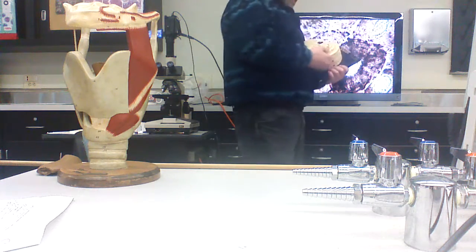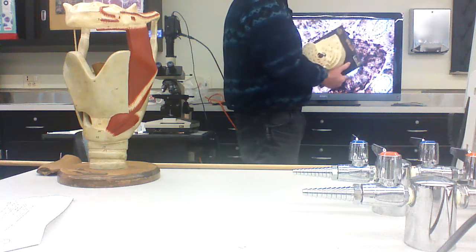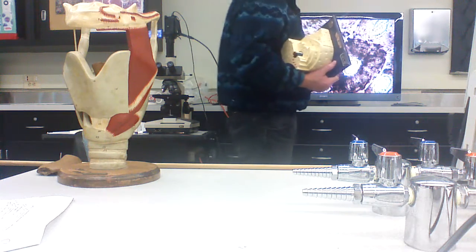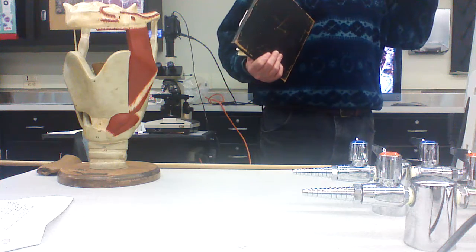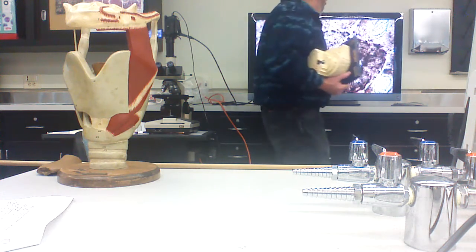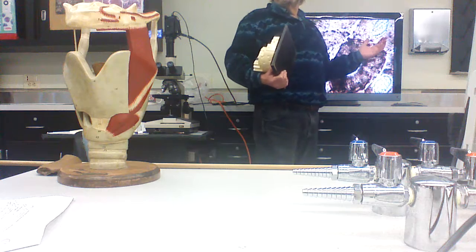And there are lateral canals which attach one Haversian canal to another. So if you have a cross section of compact bone, you're going to see these cylindrical units. You know it's a cross section because you see those cylindrical units. I've got a picture of a longitudinal section, you're not going to see them. And if you have a lateral connection between two osteons, that's a what?